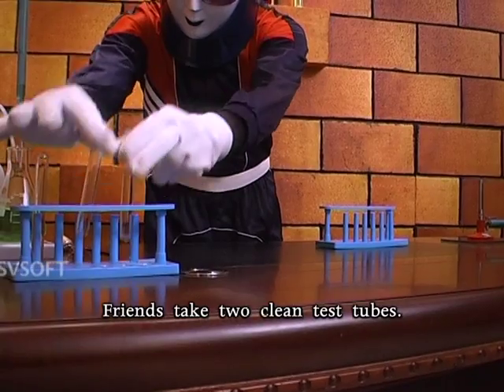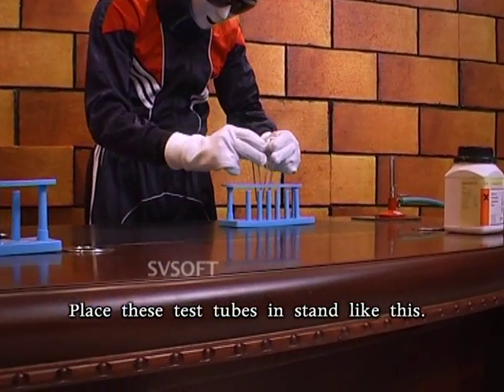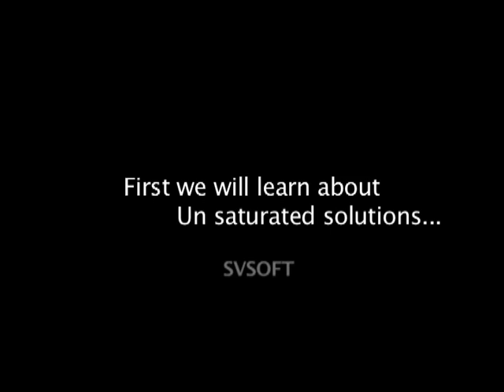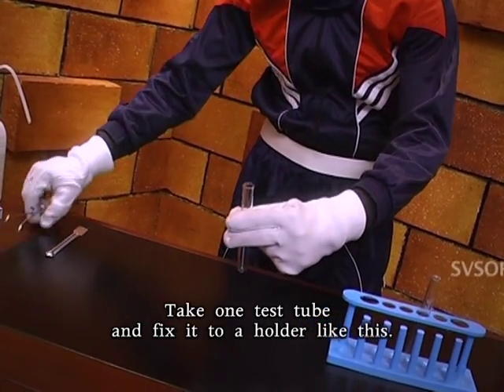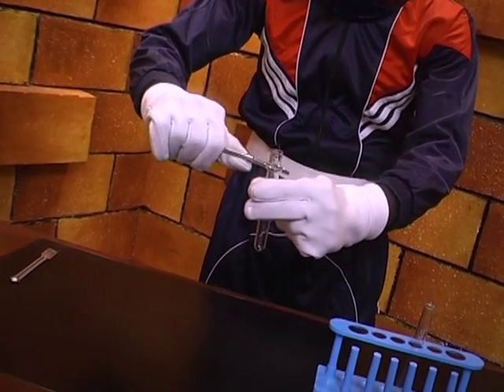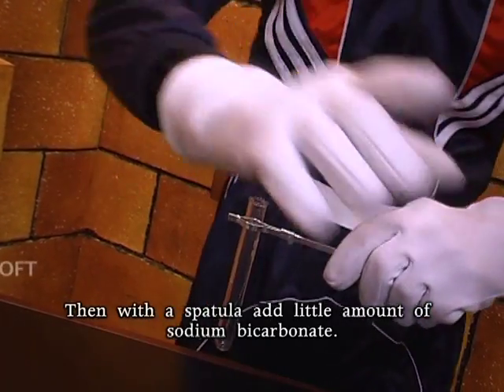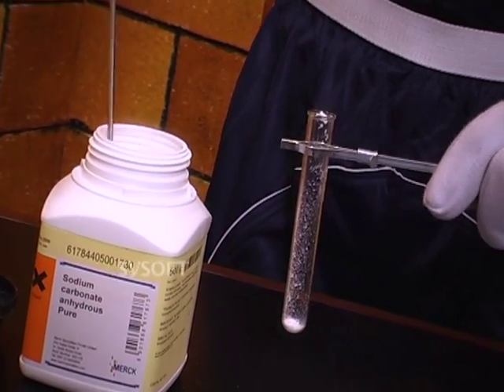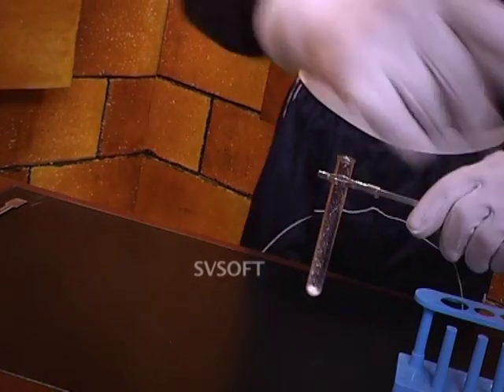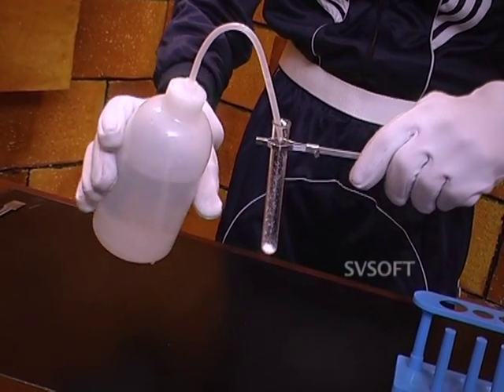Friends, take 2 clean test tubes. Place these test tubes in stand like this. First, we will learn about unsaturated solutions. Take one test tube and fix it to a holder like this. Then with a spatula, add little amount of sodium bicarbonate. Now add distilled water to half of the test tube.